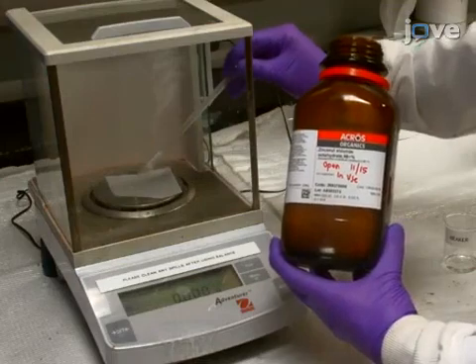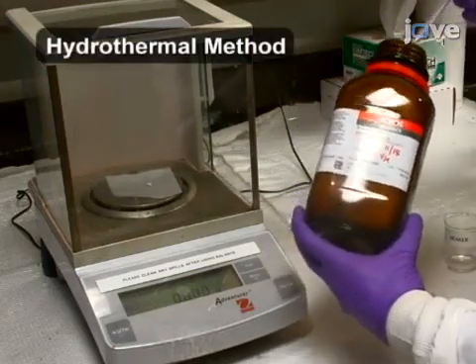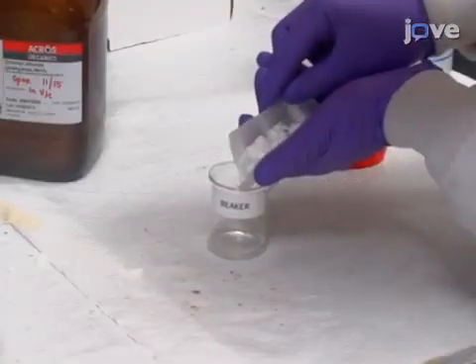To synthesize alpha zirconium phosphate using the hydrothermal method, dissolve 6 grams of zirconyl chloride octahydrate in 3.75 milliliters of deionized water in a beaker.